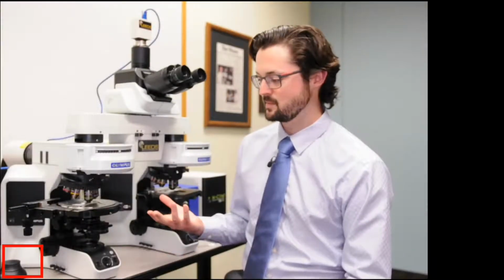So to get started, what you have behind me is an LCT.